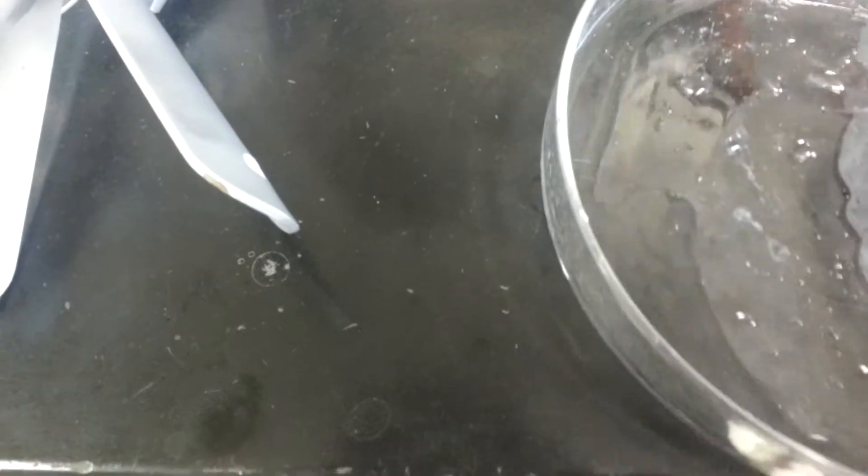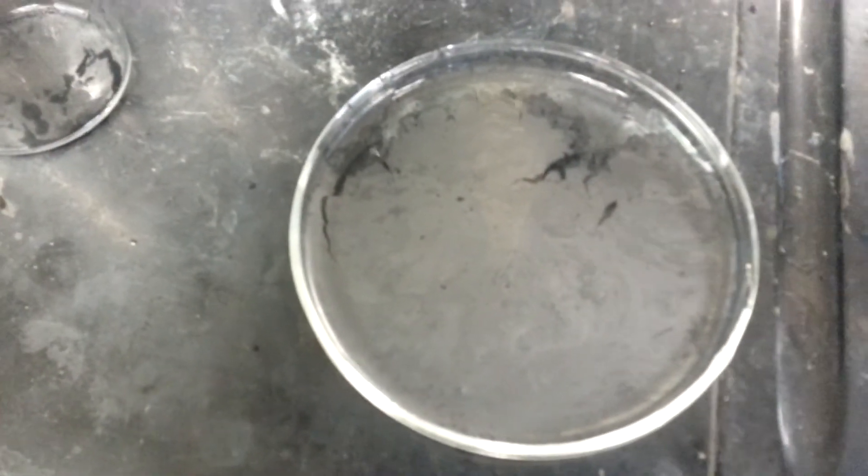It's not quite as dramatic as the one that I just did. I just did this dish right here and that all formed in like two seconds flat. I think it's because the concentrations are a little less.